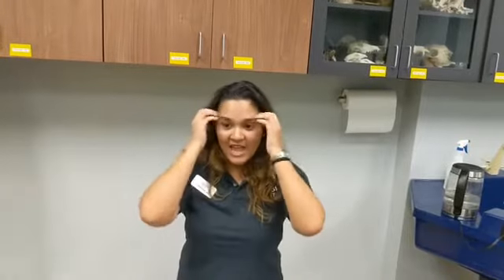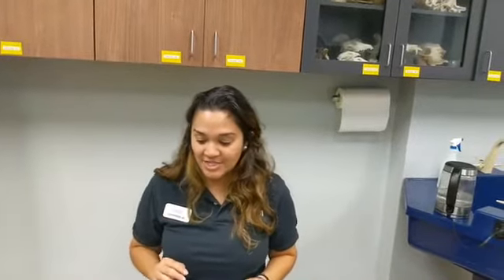After we do our pH meter test, I'm going to do an original to me experiment, new to me experiment with you, where I brought a few different types of dairy products, and we're going to be seeing if those are acids or bases. So hopefully that'll encourage you to do it if this is new to you.